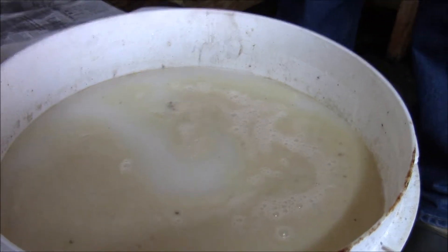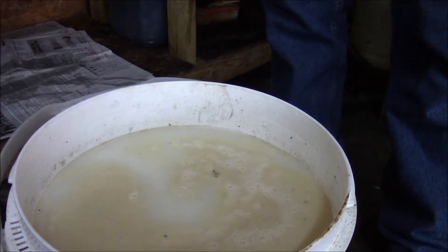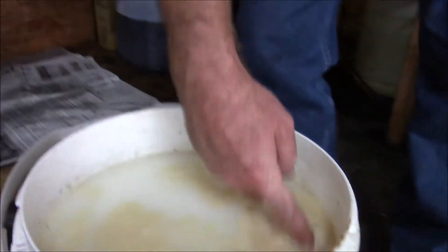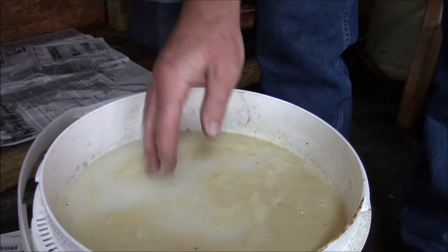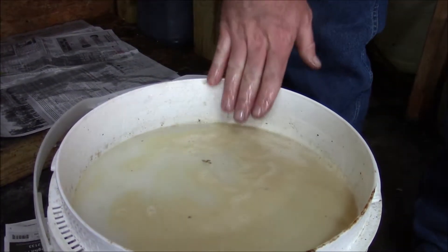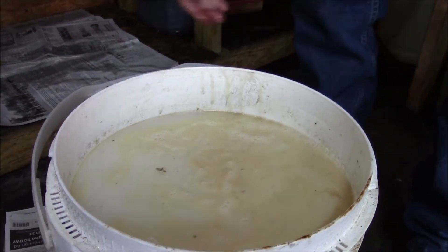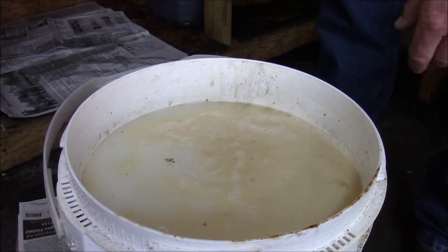Off a complete drain, I'll start to see this kind of residue come out, then I'll slow the flow so I can try to capture as much of the white wash water as possible. There's biodiesel in here — it doesn't look great, but this little scum on top isn't much of a waste. This is about where you'd want to stop. There's really no use in trying to drain any more water out than this.